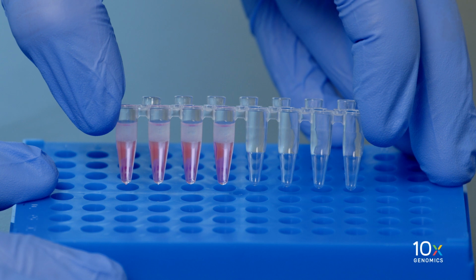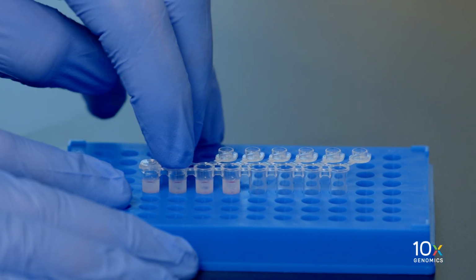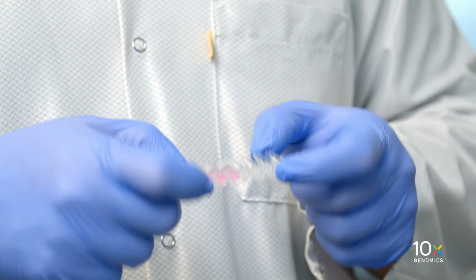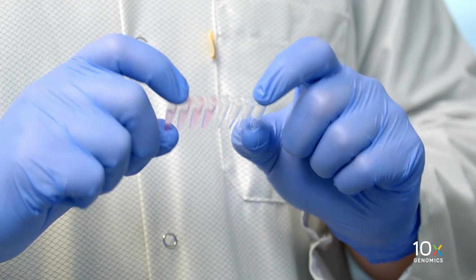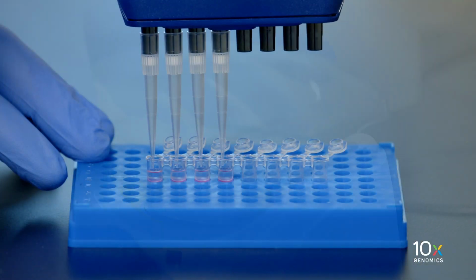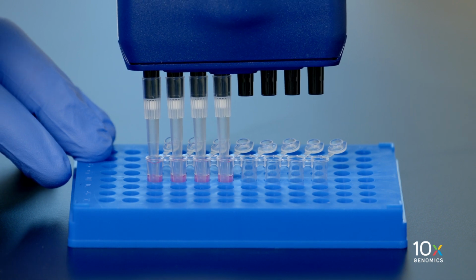If biphasic separation is incomplete, firmly secure the caps on the tube strip. Do not invert without firmly securing the caps. Mix by inverting the capped tube strip 5 times and centrifuge briefly. A smaller aqueous phase volume indicates a clog during GEM generation.